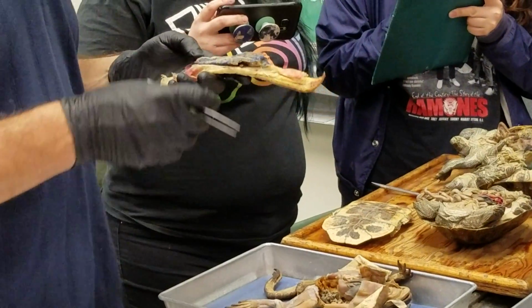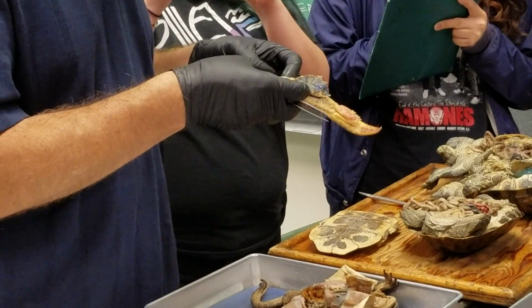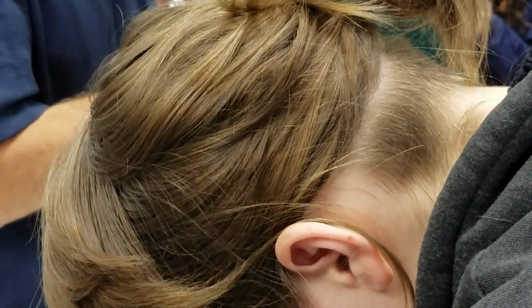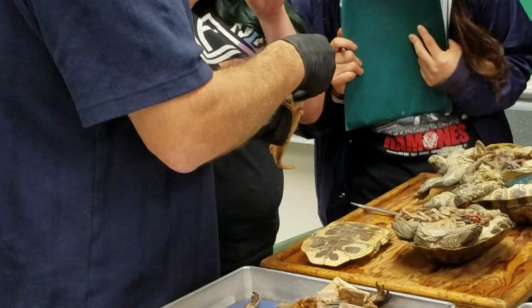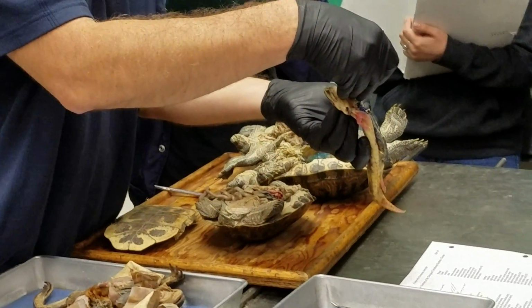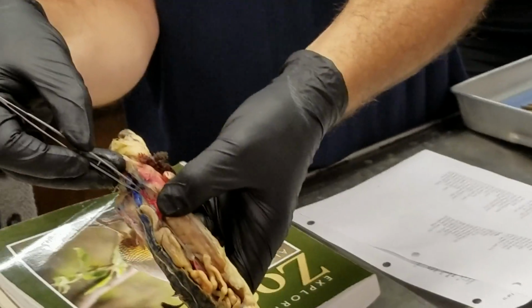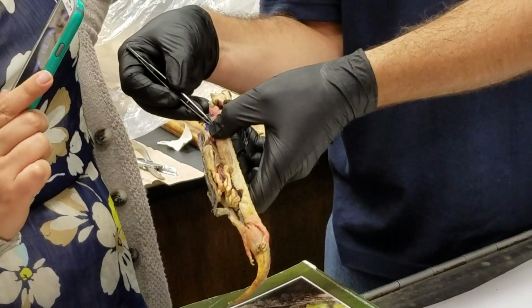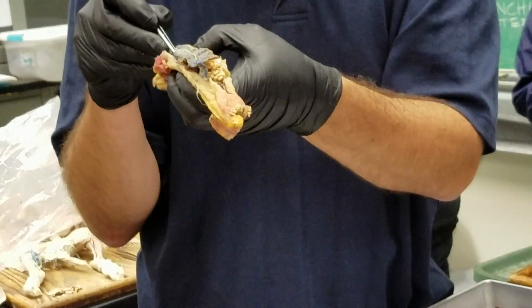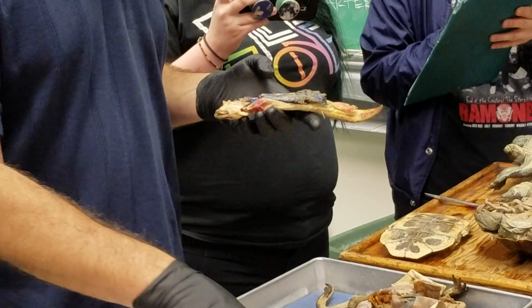Pulmonary vein. The pulmonary vein drains the lung and drains back to the heart, and you can usually see it. You find the lung, which is easy to do, and you look for something that's running from the lung towards the heart, right there. That is the pulmonary vein. And sometimes they're red, sometimes they're uninjected, sometimes they're blue, so you have to be a little bit careful. Depends on the way the injection went. That was the pulmonary vein from the lung back to the heart. Okay. And they run right along the lung. Okay, so those are the vessels that they had you do right around the heart.